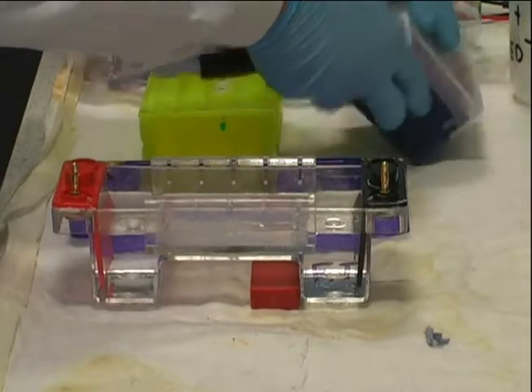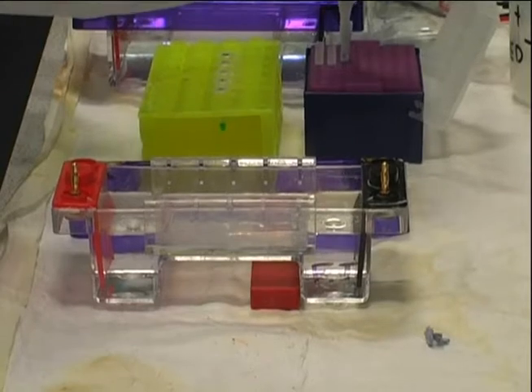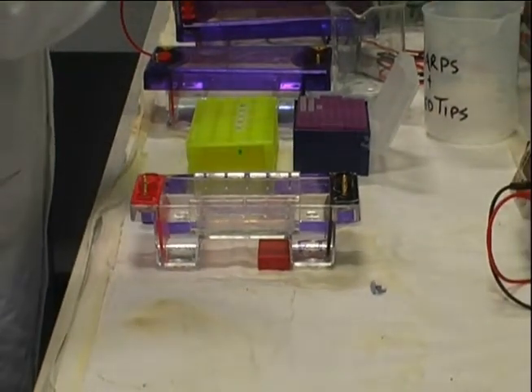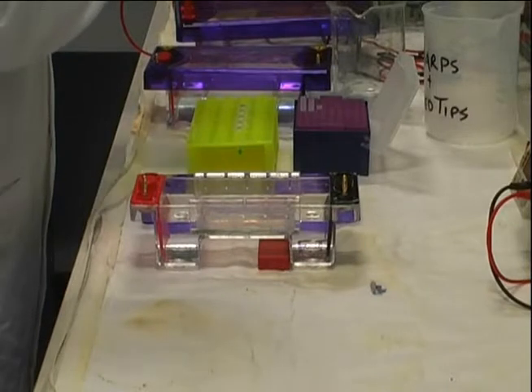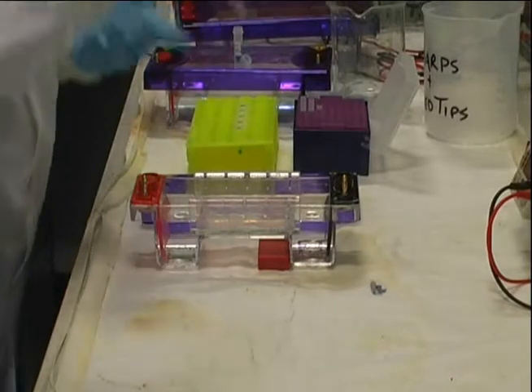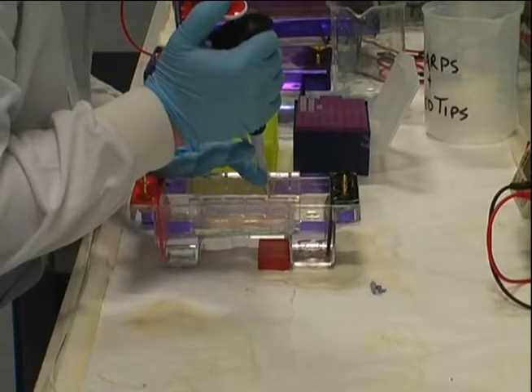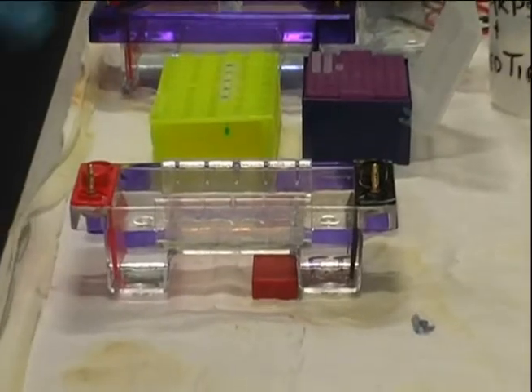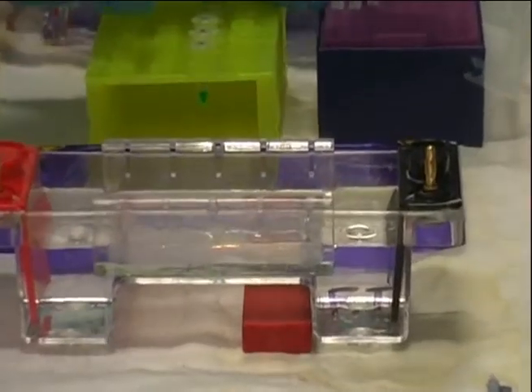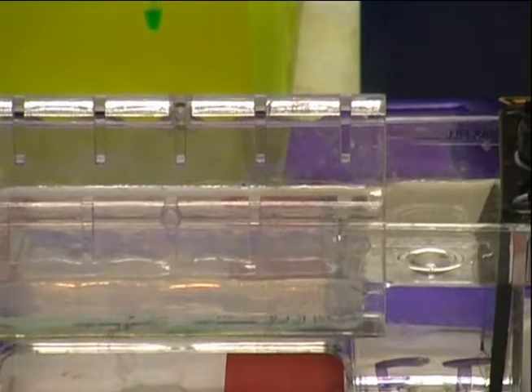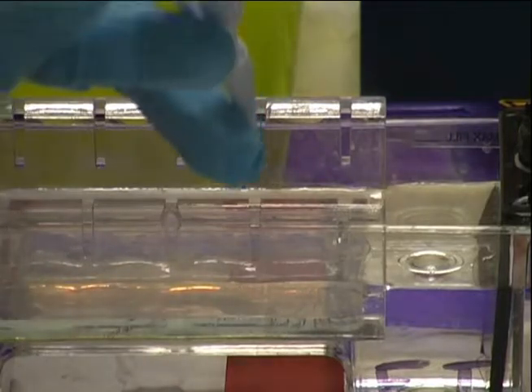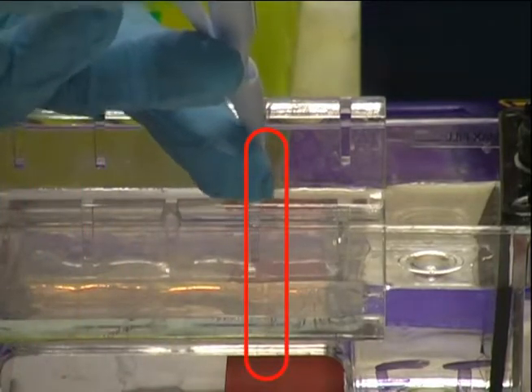Using a micropipette, small volumes of between 2 and 10 microliters of the individual PCR reactions are very carefully loaded into the wells formed in the gel by the comb. This is a very tricky skill to master, as taking the pipette tip into the gel too far will perforate it, and not putting the tip in far enough will cause your sample to float away and be lost. Practice is the key to ensuring repetitive and complete loading of DNA samples every time. Wells are sometimes hard to see under the buffer, and for illustration purposes we have highlighted them in each case with the red ovals.